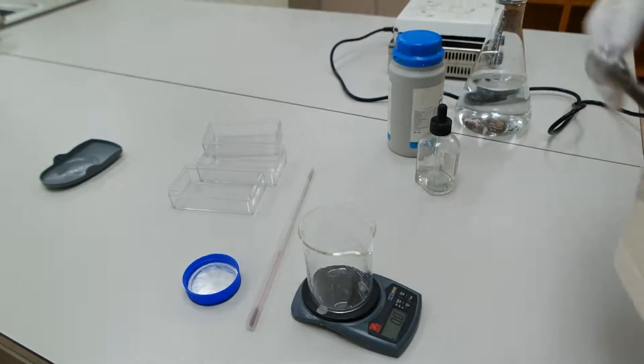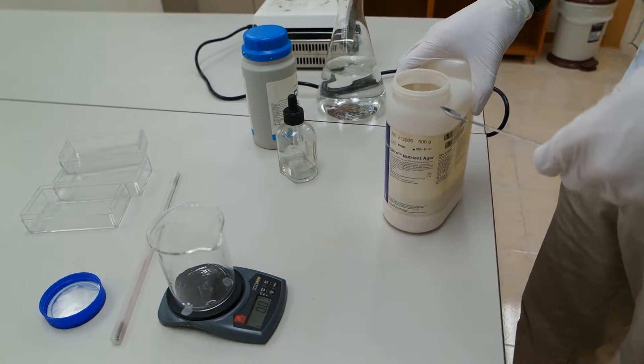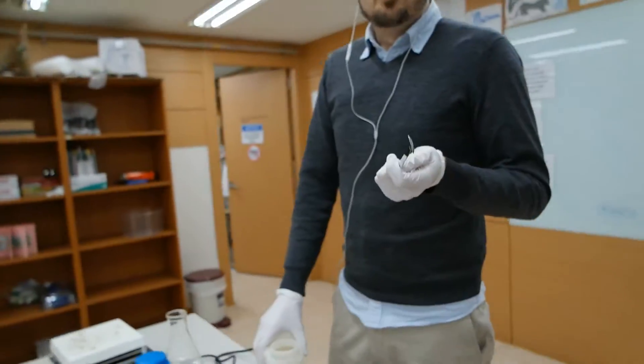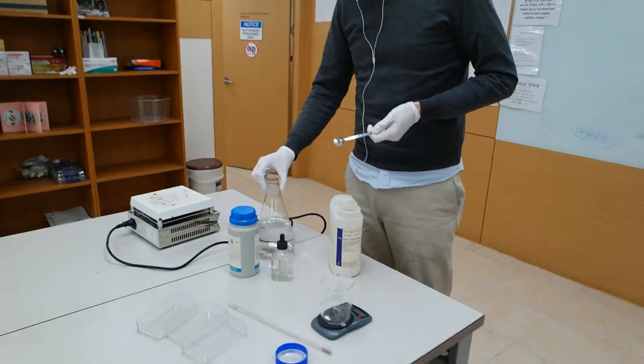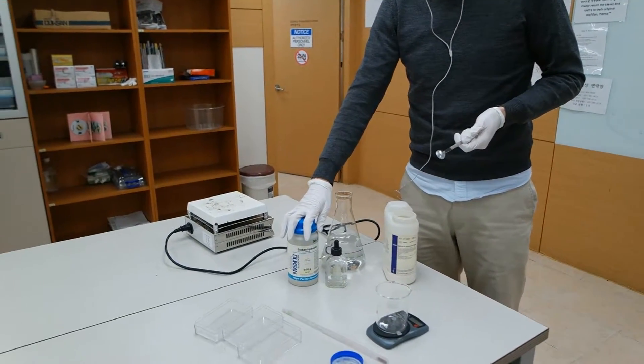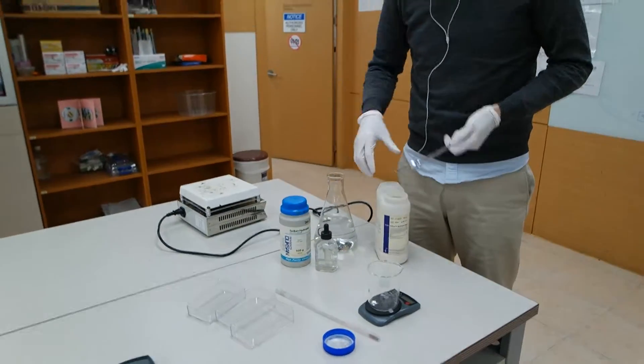Well, tomorrow when we do a lab, we're gonna be looking at surface area and volume ratio. So now I'm gonna make agar, but I'm gonna add a strong base. So it's gonna turn pink.